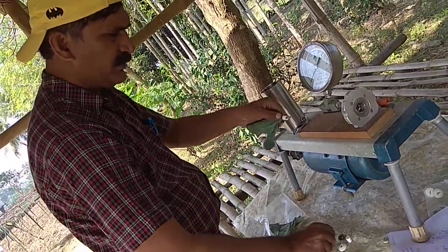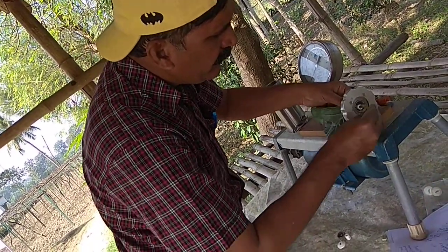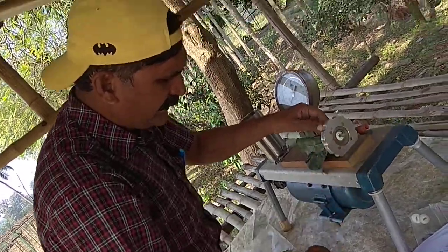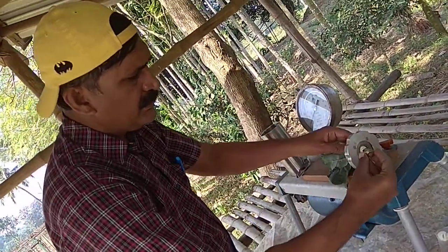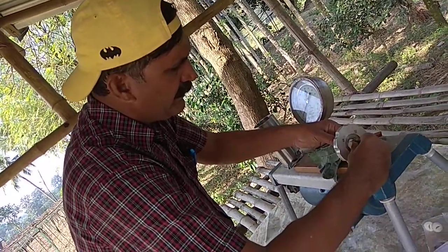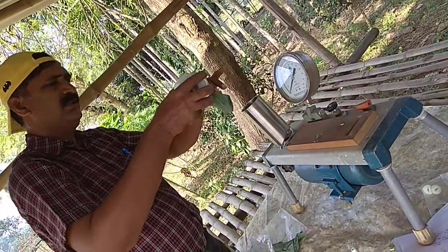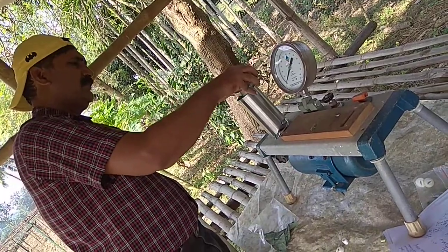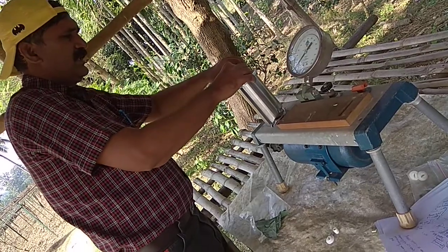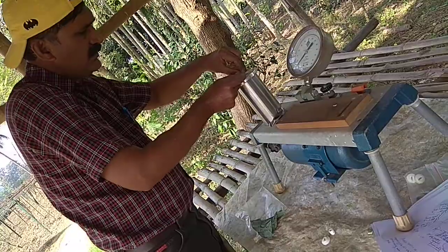Again, you should get it in this way, then you take the rubber clip, then again insert the bronze clip in this way. So insert it in the chamber immediately, because while time is passing, it again requires a plain cut.